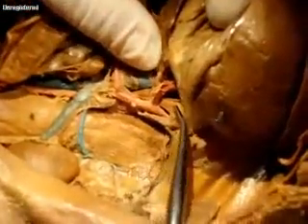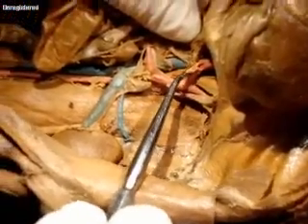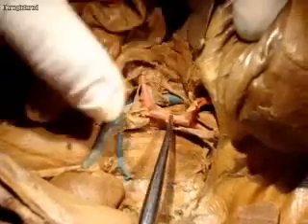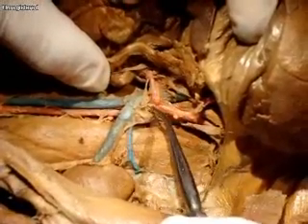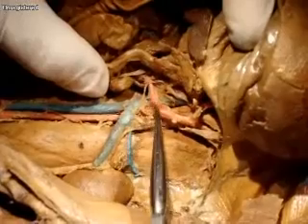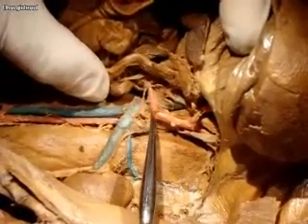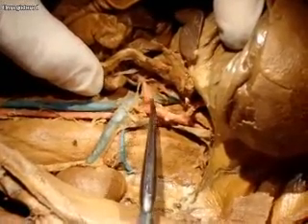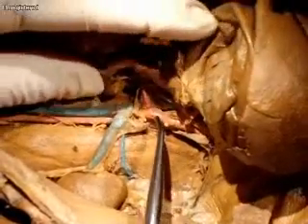Continuing with the blood vessels — here's the abdominal aorta coming down. This first branch coming off is going to be the celiac trunk. Then this continues, and the next branch coming off is going to be the superior mesenteric artery. On some of the specimens it looks like there's a little bit of nervous tissue that lays right across the top of this superior mesenteric artery — and that is going to be the celiac ganglion, which is part of the nervous system.